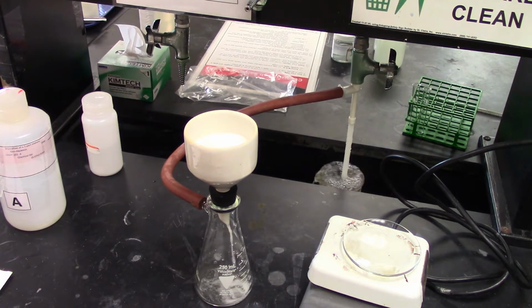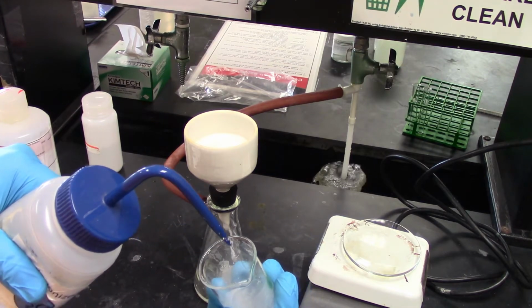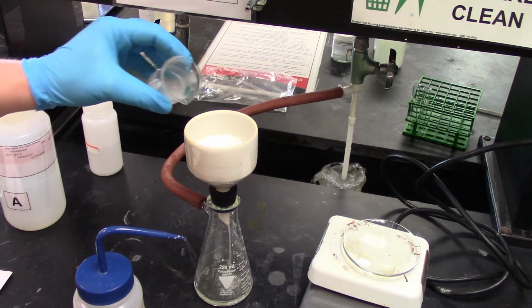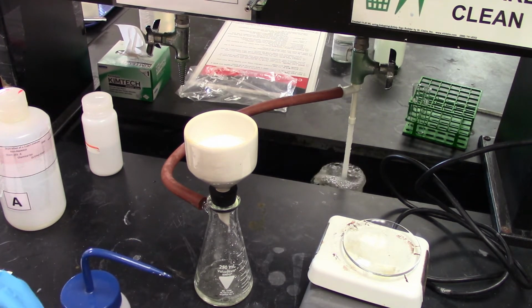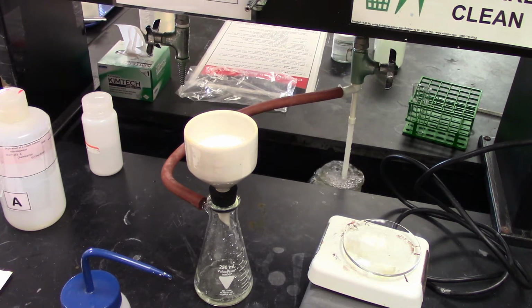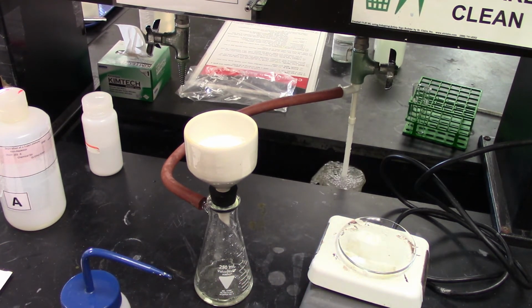And we can definitely use a little bit of DI water, knock loose anything that's stuck to the rim of the flask. We are going to lose a little bit, that's fine. This is just part of your error. And we're going to let this run for about 5 minutes. I'm going to stick it over here on a pre-weighed watch glass, heat it up at a low heat, like 2 to 3, and give the water time to come off of it. And then we'll weigh it and see how much we recover.